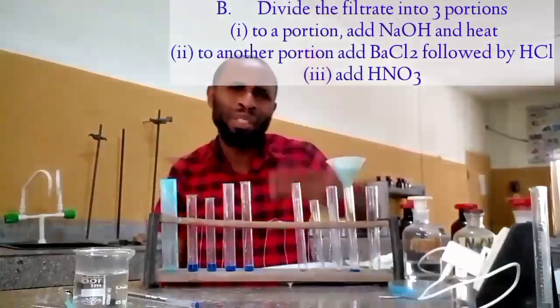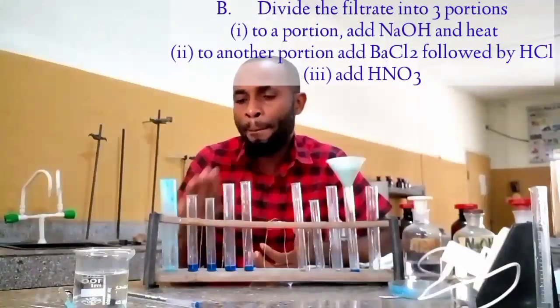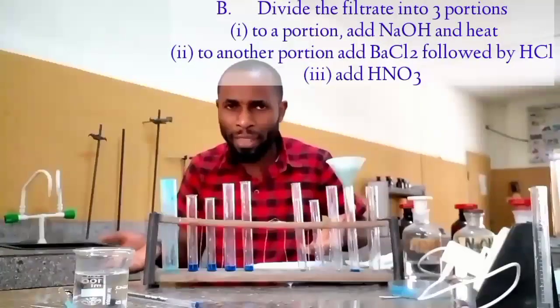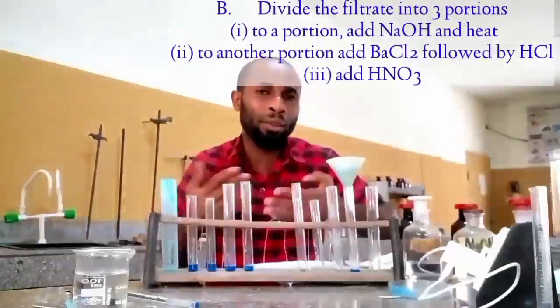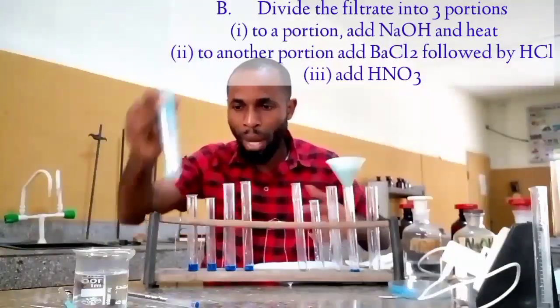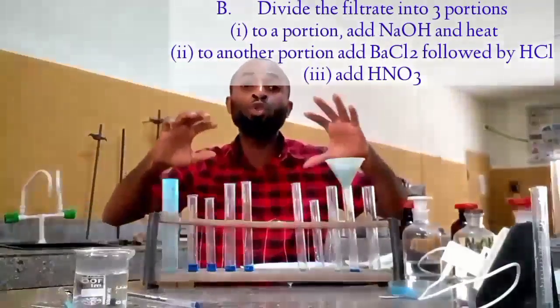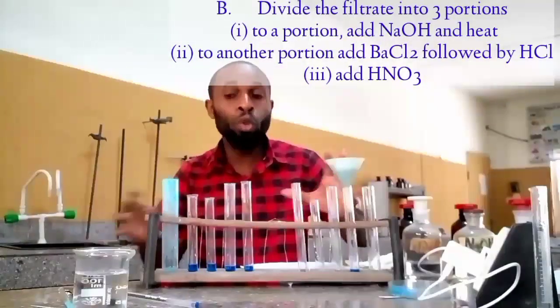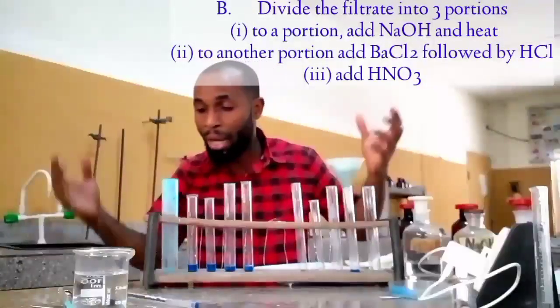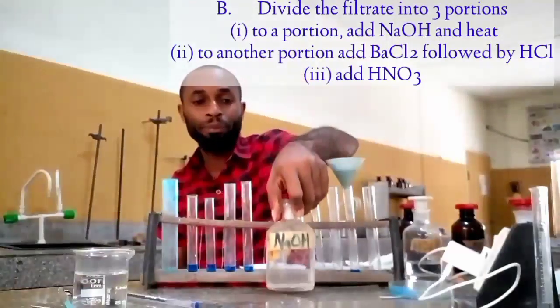The reason why I will not make use of heat is if I make use of heat, I am the one that is going to perceive the odor. You are watching the video, so there's no effect. But when you are in the practical ground, you can heat with a boiling tube and not a test tube. Therefore I am only going to do what they asked me to do to demonstrate it. I'm also going to show you how the color will look, and when you heat it, how it is going to look. Okay, I'm having my sodium hydroxide here.